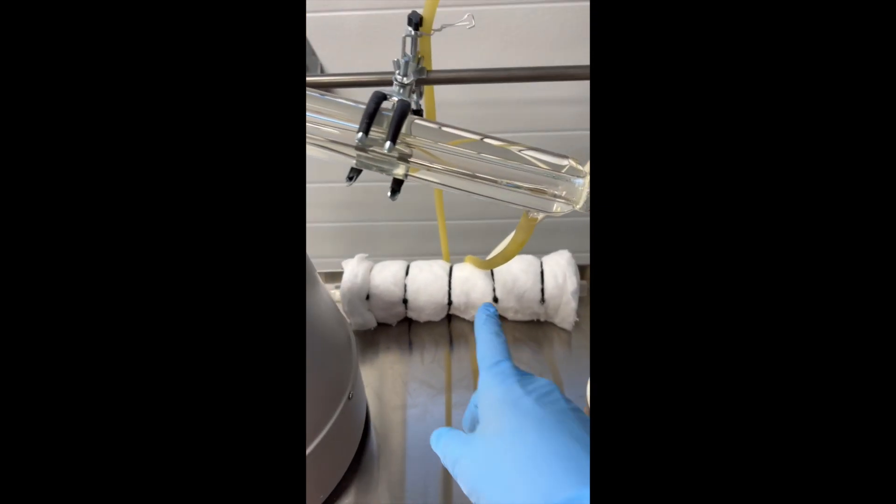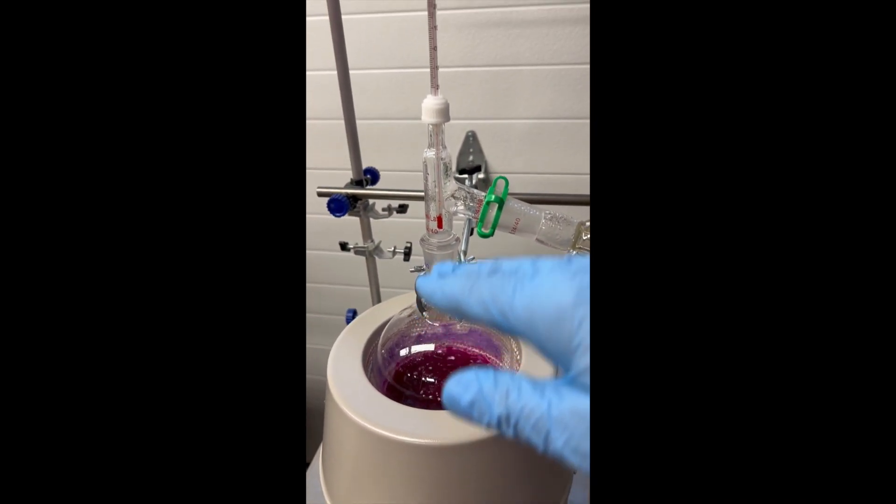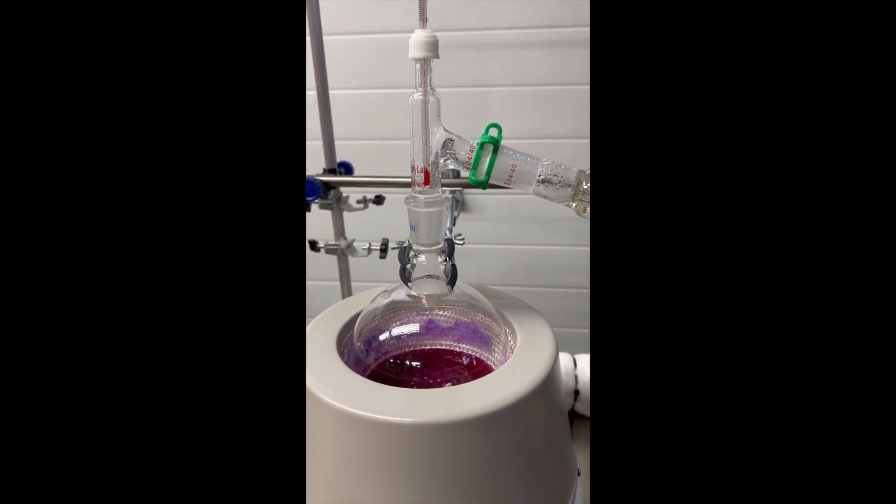For this one, I took off the reflux column. From the other videos, you would see it was the tall column. For this, you just need a basic distillation setup.